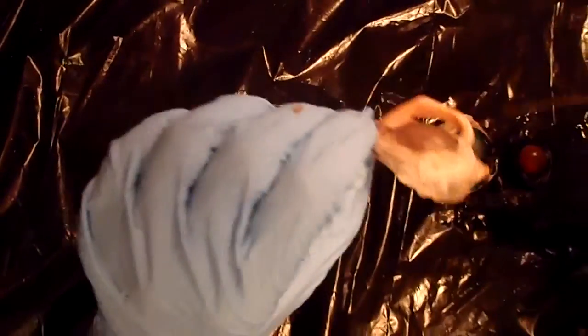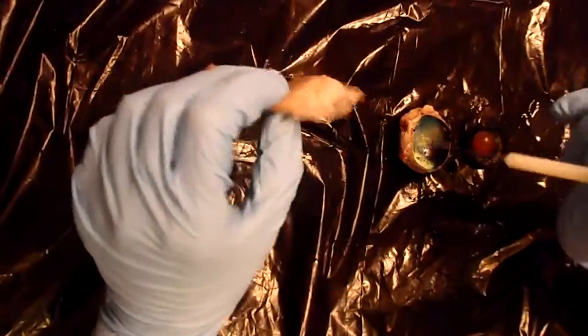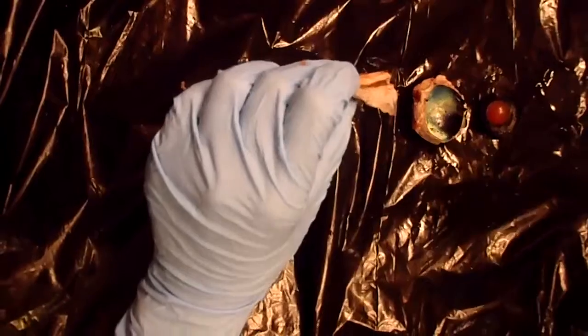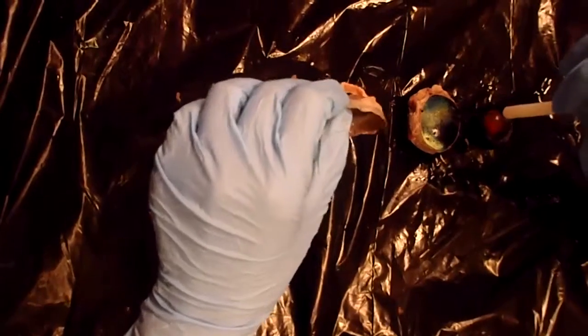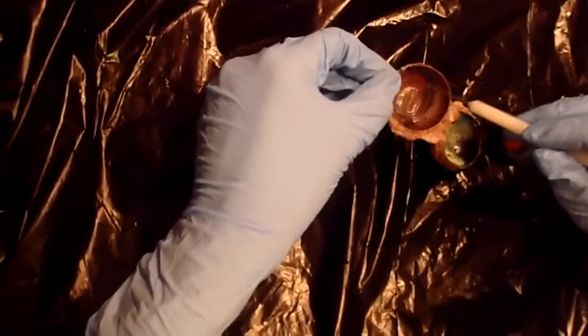Okay, we are going to talk about the cow eye. The first thing that I want to point out is the iris, and that's the most anterior portion of the vascular layer. It's visible and it's colored, and you can find it between the lens and the cornea. And the iris is found right here, around the edge.